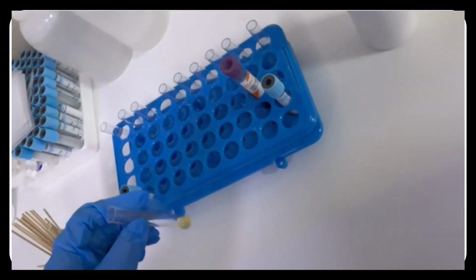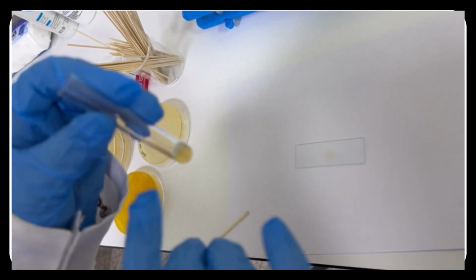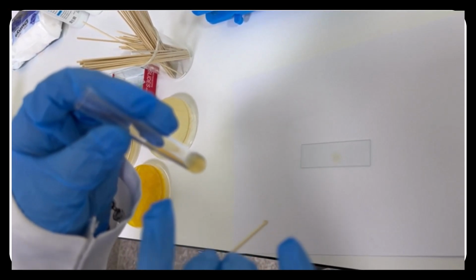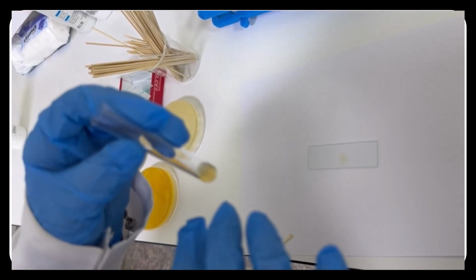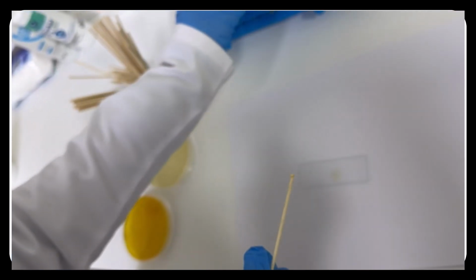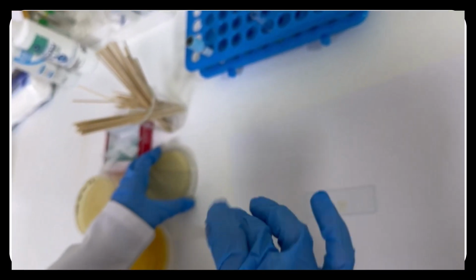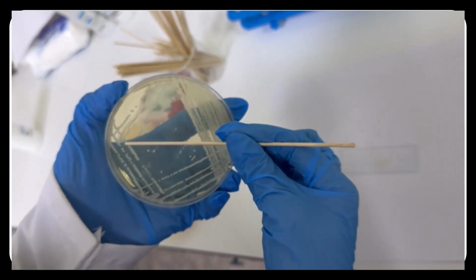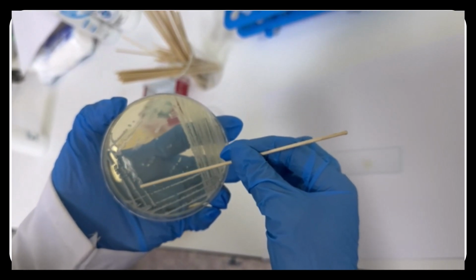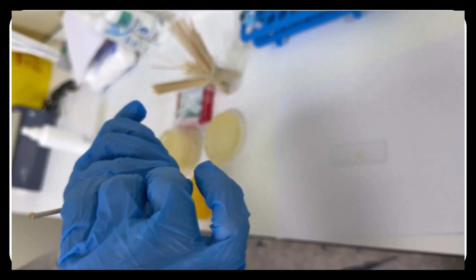Another method of the coagulase test is called the tube method, for detection of the free coagulase. If the result of the slide method is negative, we should confirm by the tube method. Free coagulase means it is a factor in the plasma that needs activation for converting the fibrinogen into the fibrin. The tube method procedure includes putting 0.5 of the plasma in a tube, then taking five to six bacteria colonies, mixing them with the plasma, and incubating for 30 minutes up to 24 hours.